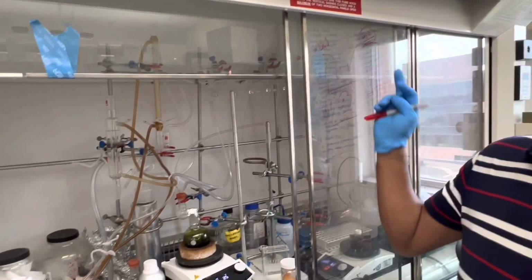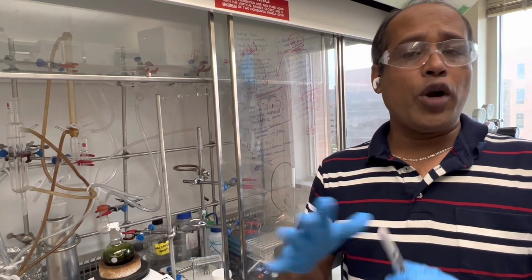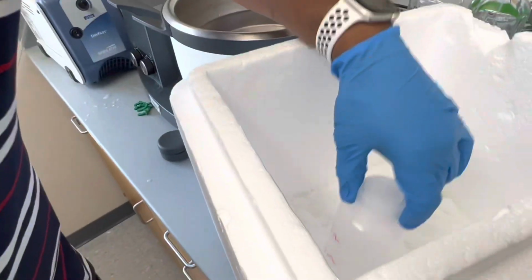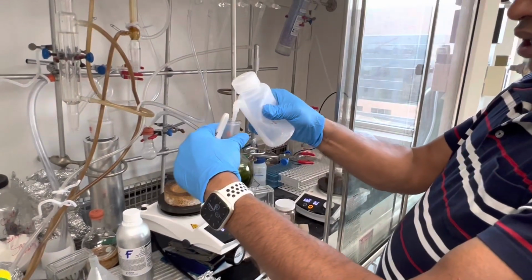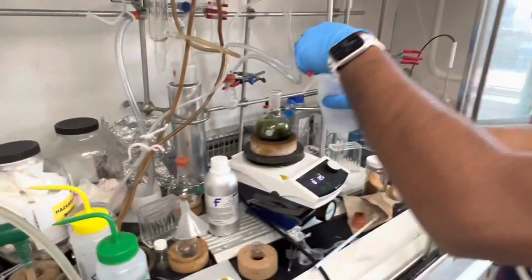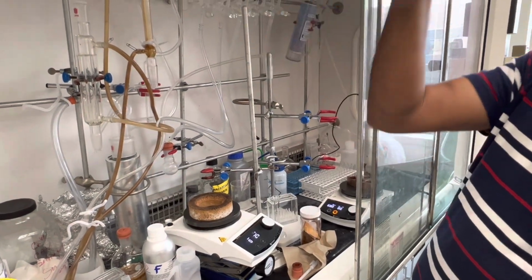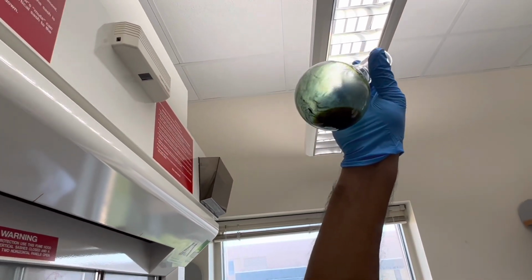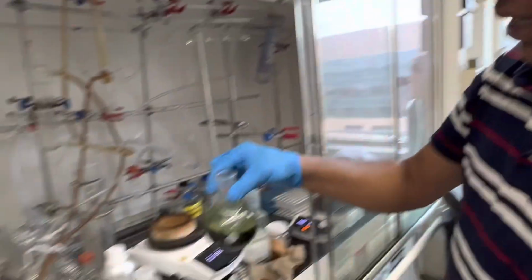From the literature, they filtered their product with the ether. So what I'm going to do is this: that liquid will not solidify in the cold, but if I use the same solvent, and you can see here I'm cooling down the diethyl ether with dry ice, and then you add that cold diethyl ether there, the liquid part will dissolve, and the product may not dissolve completely at cold temperature. In that case, maybe you can get the solid back. Do you see the solid here? So you have to filter quickly to remove that liquid, oily part. You understand? Okay, now filter. Thank you.